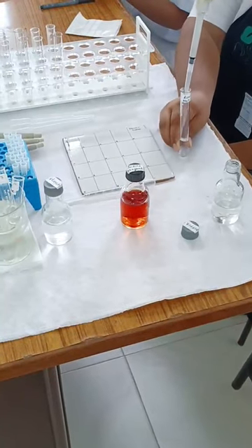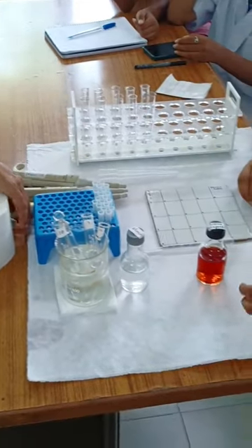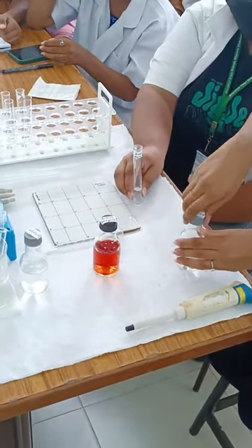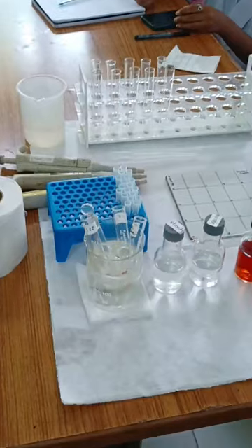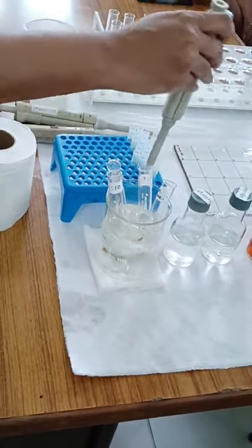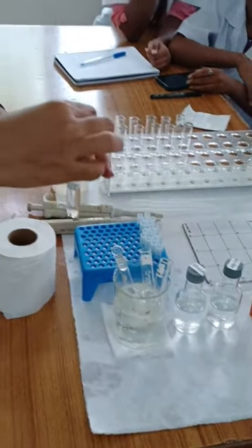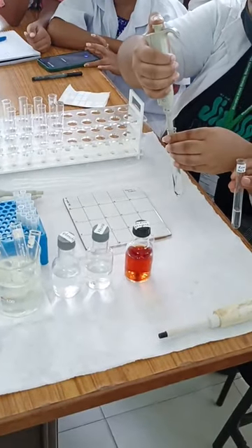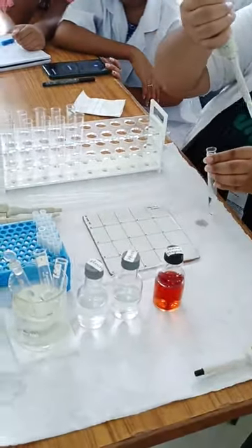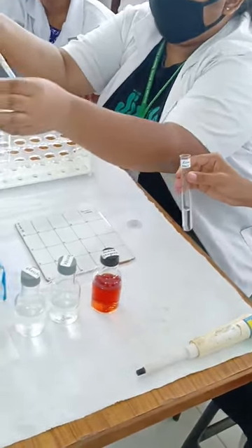So the reaction mixture contains 2 ml of 0.5% starch and 2 ml of phosphate buffer. Now we are going to take 0.4 ml of the 1-in-10 diluted enzyme. We know that enzyme is sensitive to temperature changes, so it has been kept in ice. We are going to add it now. The moment we add it, the students note down the time and the reaction has begun — the enzyme has been added to the substrate.